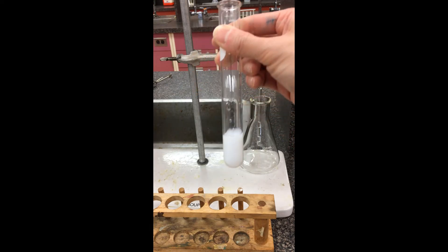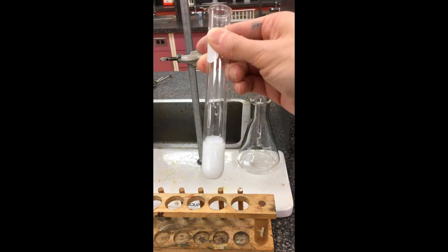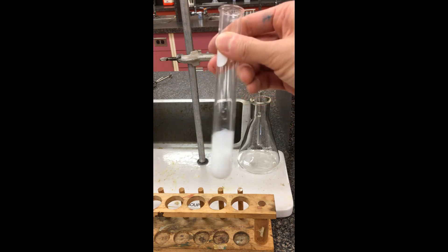Suddenly we have taken two aqueous solutions here. We've gotten this cloudy, milky sort of material. Okay, stir it up a little bit here.